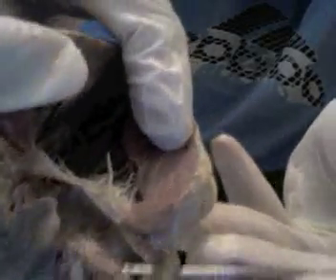Some of the internal stuff we have on here: we do have your pectinate muscles, which would be the bridges on the wall of the atrium. So right about where the pointer is, that's about where they would be.